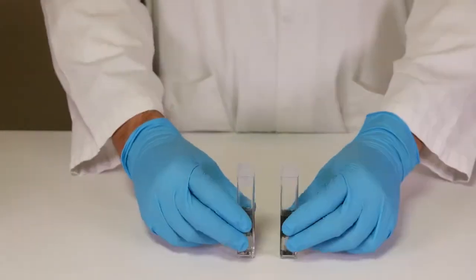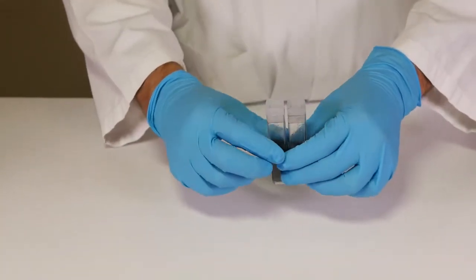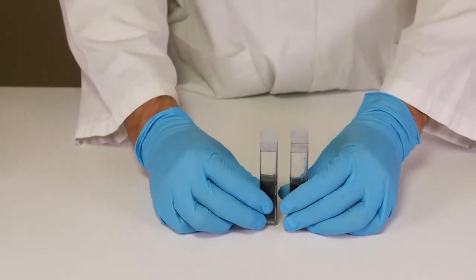Ensure both cuvettes are capped and secured and shake vigorously for approximately 30 seconds. Leave for four and a half minutes for the layers to settle out.